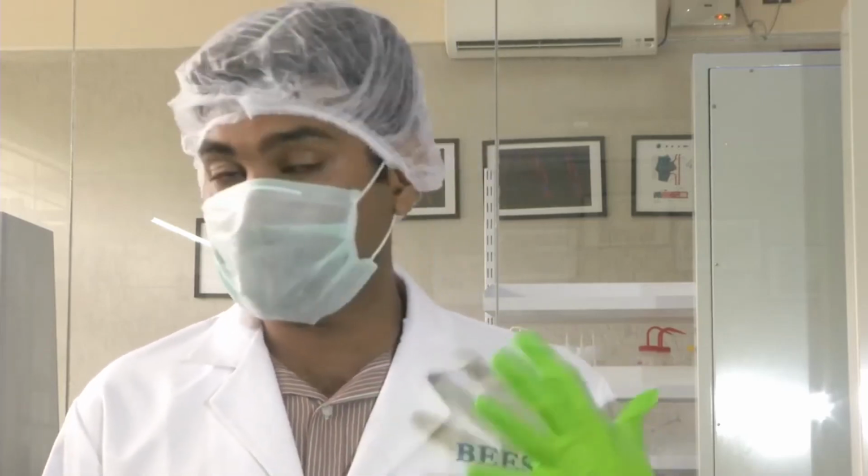These filters are first of all very costly, and they have a limit of filtering that they can do. They have a lifetime and replacement time. If there are so many dust particles inside our lab and outside the environment also, we are loading the HEPA filter to filter the particulate matter. So we have to do whatever is possible from our end to maintain a clean environment, so that the lifetime of the HEPA filter is extended.